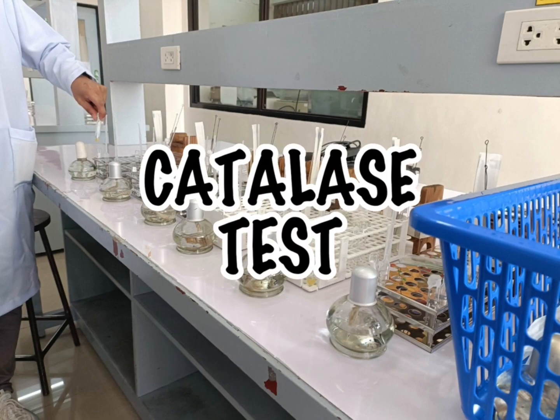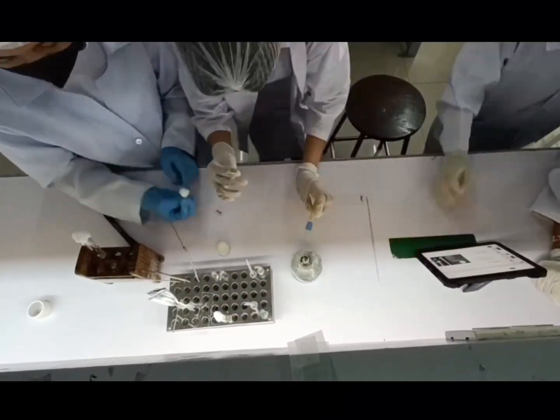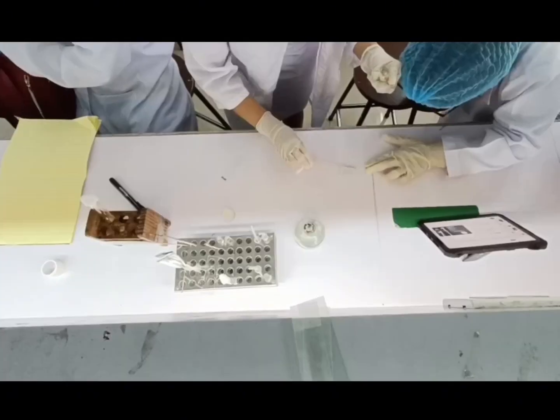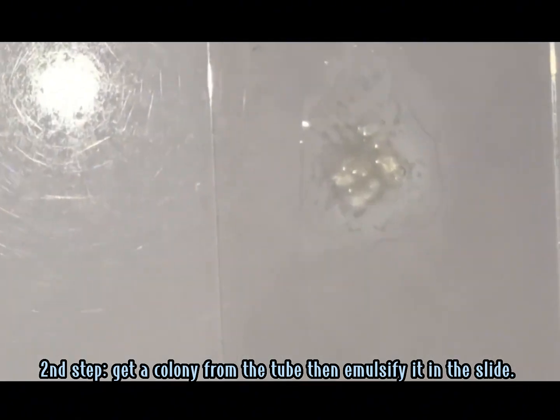For catalase testing, we will test two different organisms, which are Staphylococcus and Streptococcus. Our Staphylococcus should result in catalase positive, while the Streptococcus should result in catalase negative. To begin our catalase test, we need to drop hydrogen peroxide on our slide and then emulsify the colony afterwards.